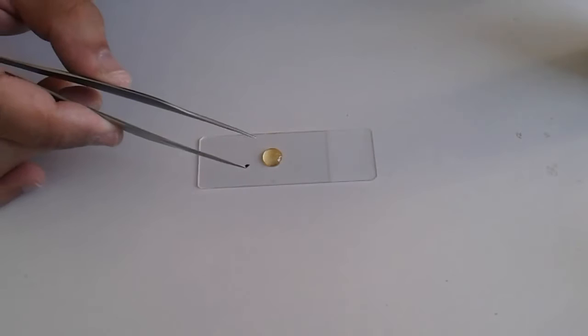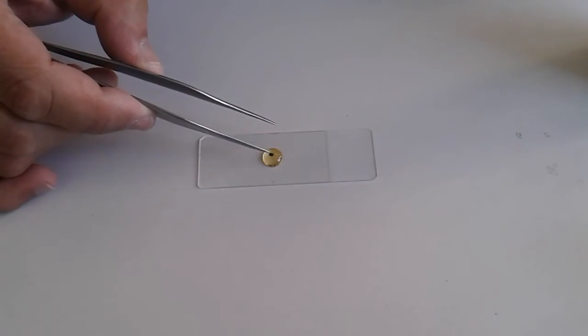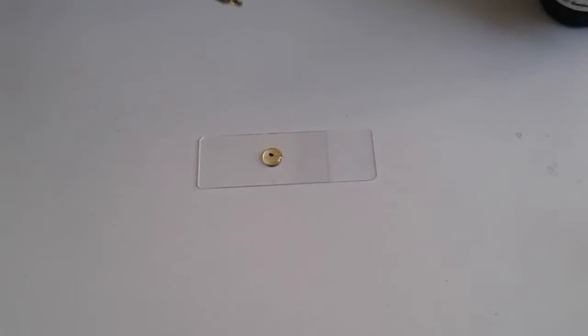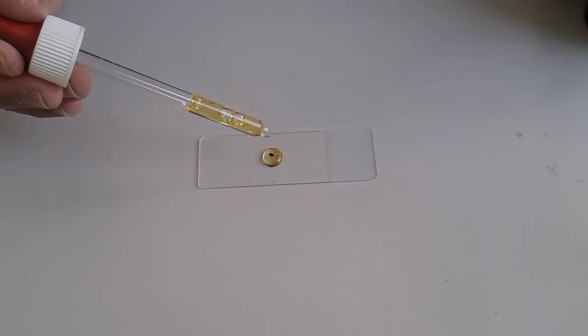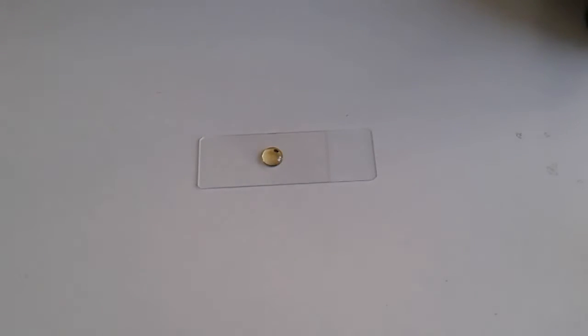The first thing you have to do when you see a tick is contain it because those guys carry diseases. We put it into a plastic container for a few days. It apparently died because it stopped moving, and now it's going to be observed under the microscope. I'm making a permanent mount now.